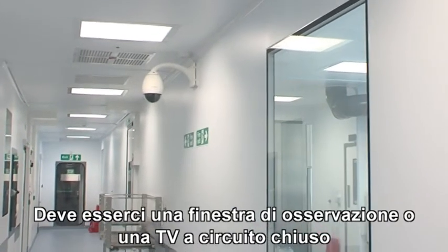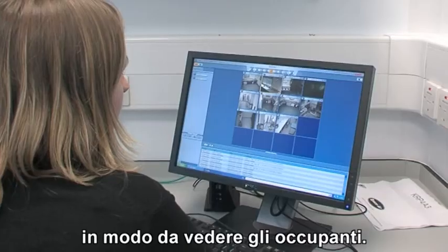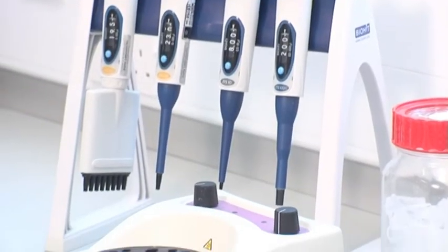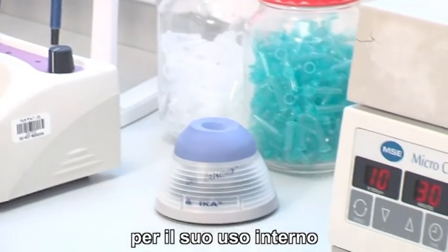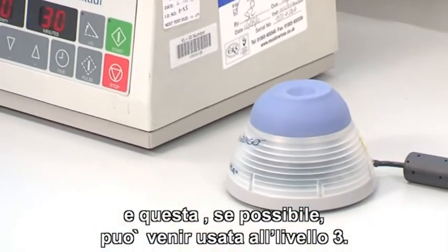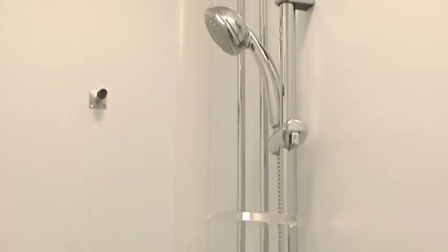The lab must have an observation window or CCTV so that occupants can be seen. The lab should contain its own equipment for level 4 and, as far as is practical, for level 3. And shower decontamination of staff.